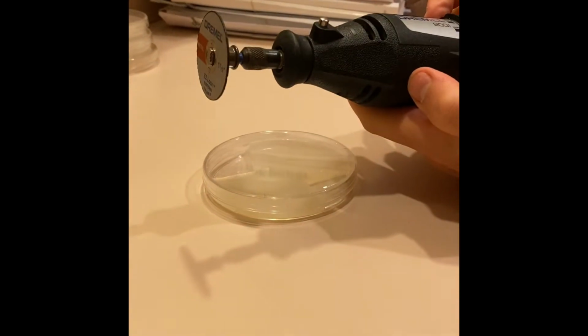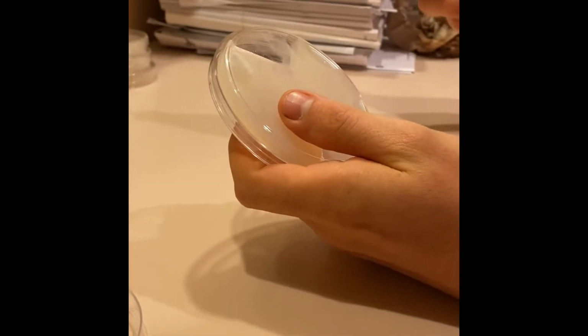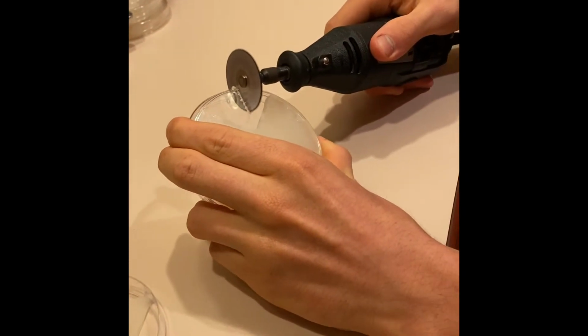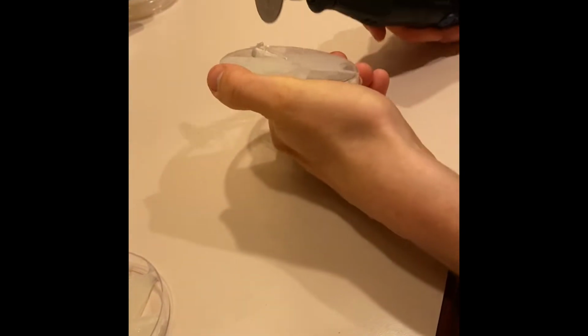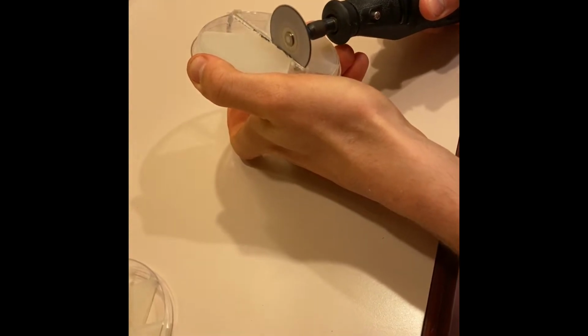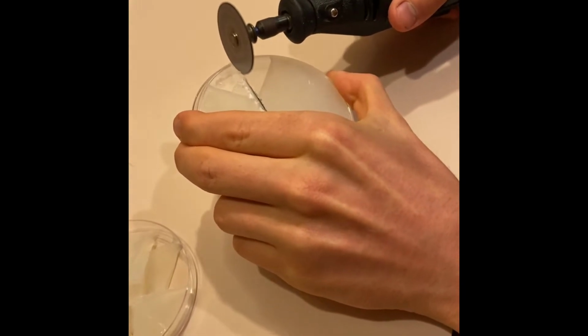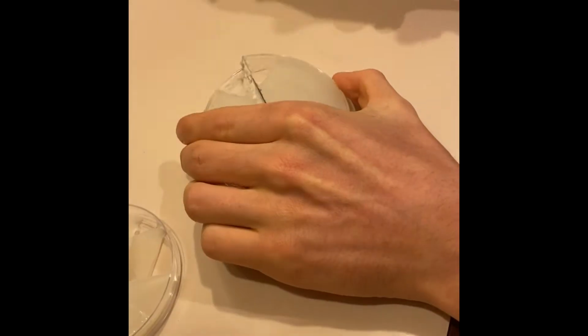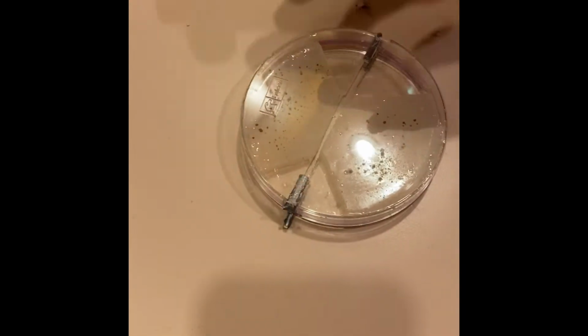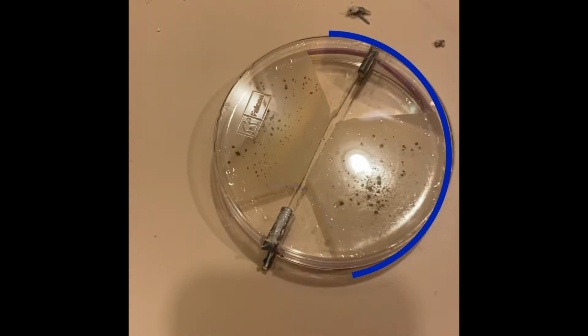Now you might be thinking, could an electrical signal somehow travel on or through the plastic and give a false reading? The short answer is not likely. We have tested the plastic plate by itself, and it will not conduct a signal from one side to the other. Plastic is not a conductive material. However, if the plastic plate had a fine layer of water vapor spread across the surface, it could potentially conduct a signal. This is why we cut the plate in half and completely separate the 2 sides as a control against this possibility. The only thing connecting one plate to another, other than the mycelium, are the wooden shims on the edges and the rubber band on the exterior.